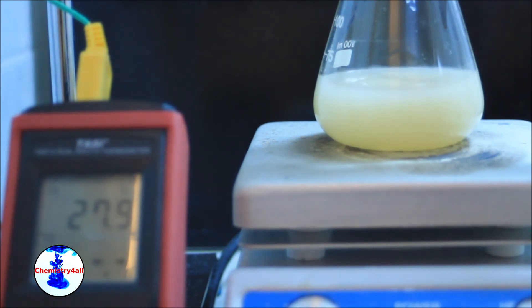Here you have a time-lapse of the distillation. Notice that the boiling point is different from the standard boiling point of ethanol. This might be due to the error of the instrument and the fact that the pressure of the lab differs from one atmosphere.